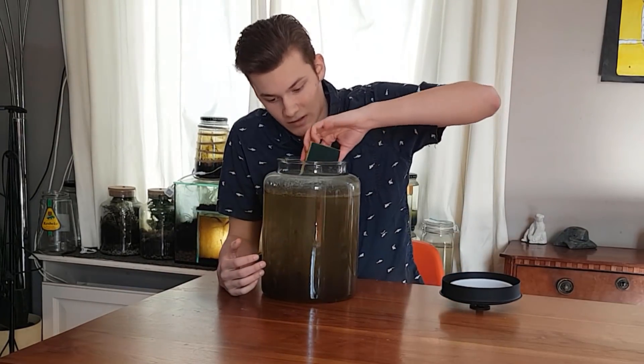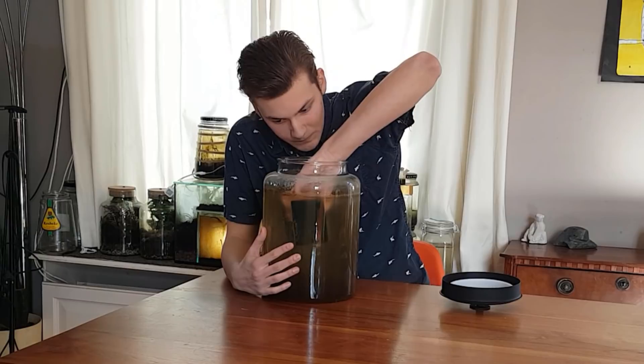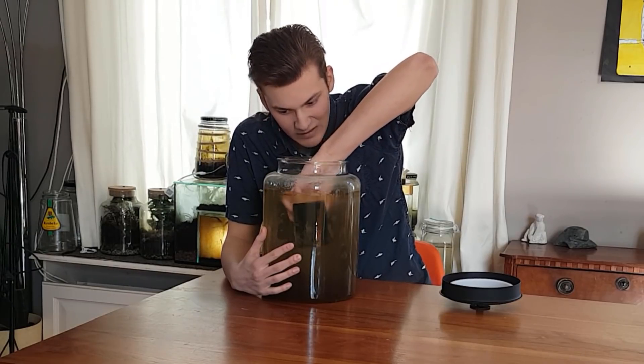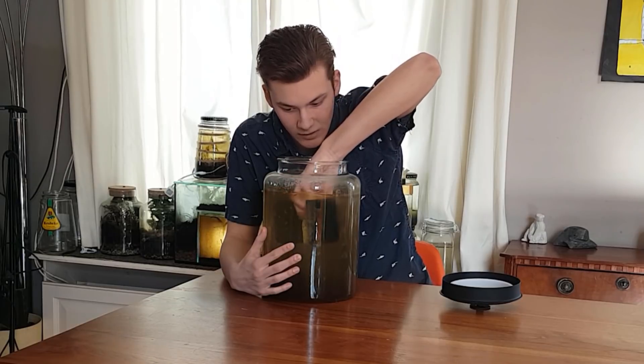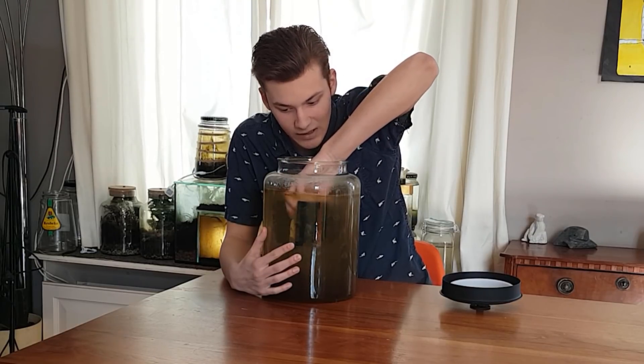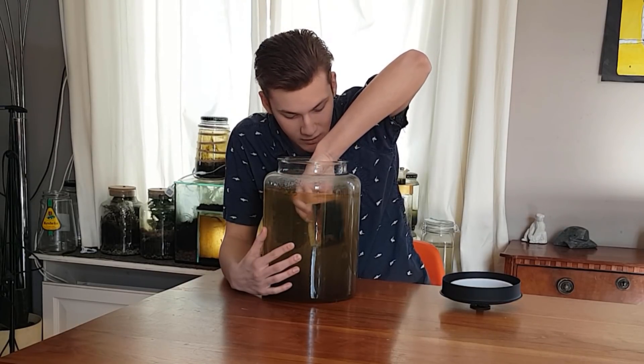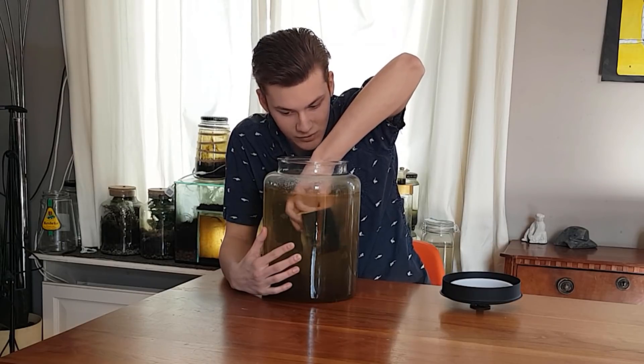So I guess I'm going to start cleaning out the glass now. And I don't know if you can see it from there, but the water is crystal clear. And if I clean the glass, the entire ecosphere seems to be just healthy.